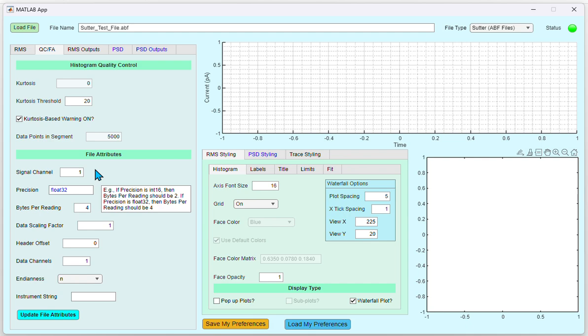If you change any of the fields on the file attributes, make sure to click Update File Attributes so that these changes get reflected in the data analysis. The fields under File Attributes, except signal channel and instrument string, are updated automatically from the header section of ABF files. For DAC files, the program expects a text file containing these fields. More information about how to set this text file can be found in the compatible file type document included with this app. Now, let's go back to the RMS tab.